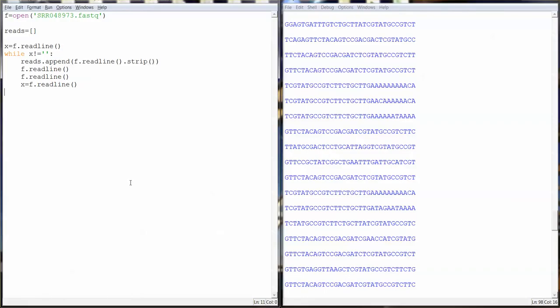So how are we going to find that? We're going to make a dictionary. Basically, we're looking for k-mers, and we're just going to go through our reads. So for read in reads, we don't want to do all 4 million because that's a little bit overkill. So let's just do 200,000.